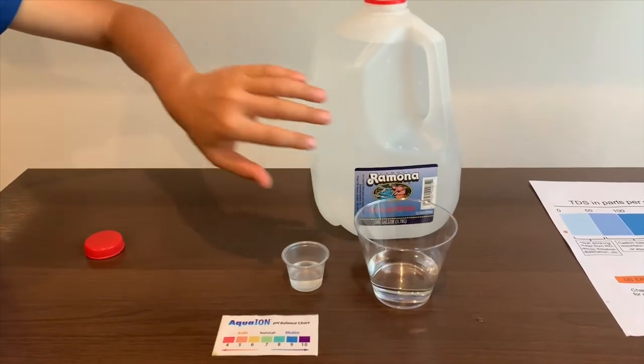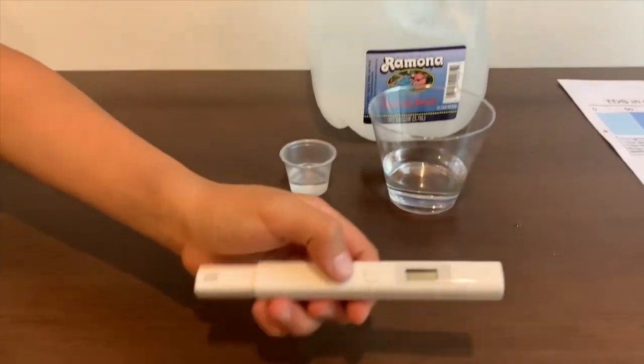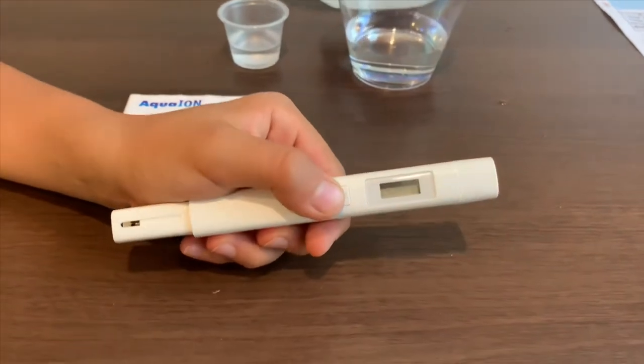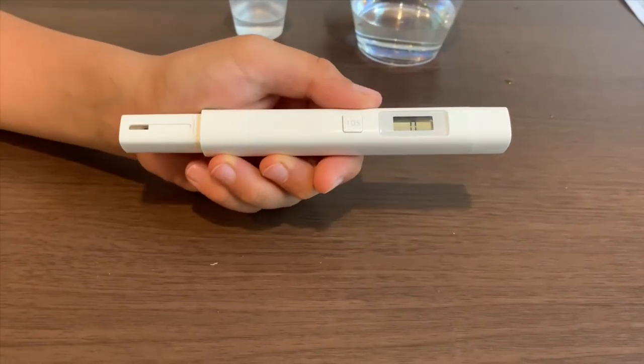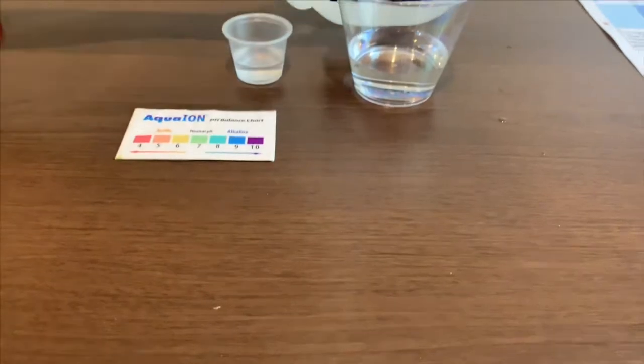First, let's test the TDS level. If you want to buy this TDS tester, check the link down below. Turn on the TDS tester, make sure it says zero, and put it in.